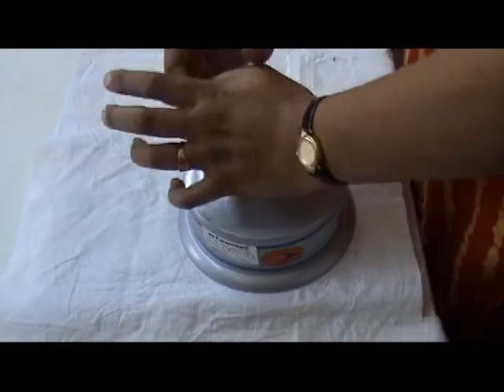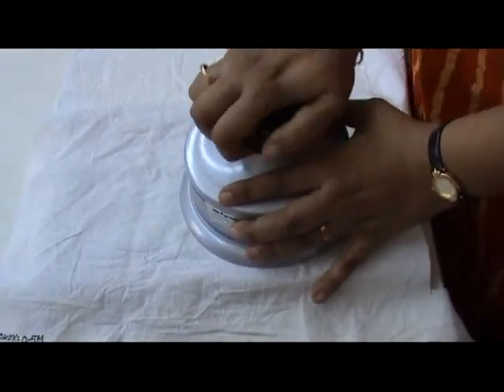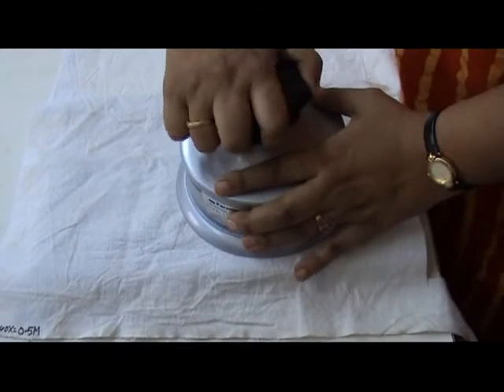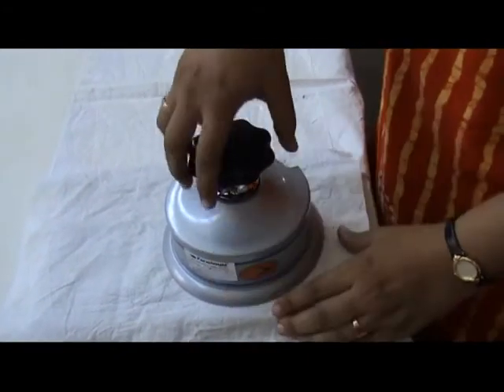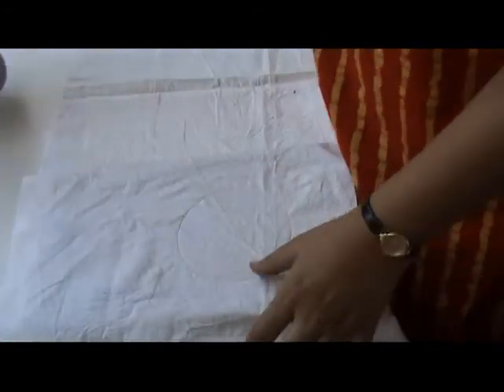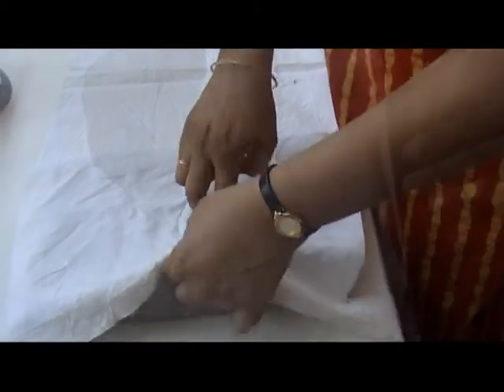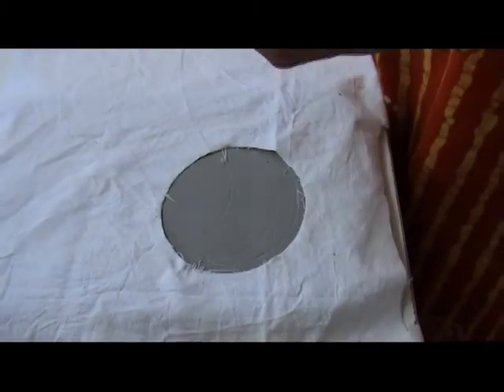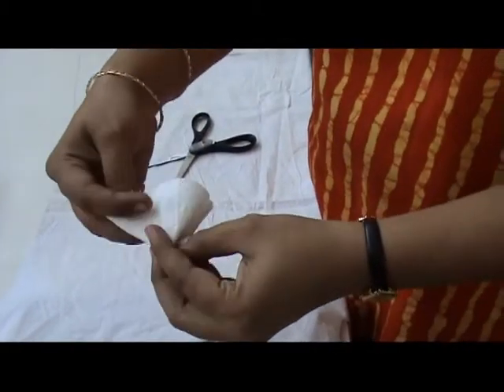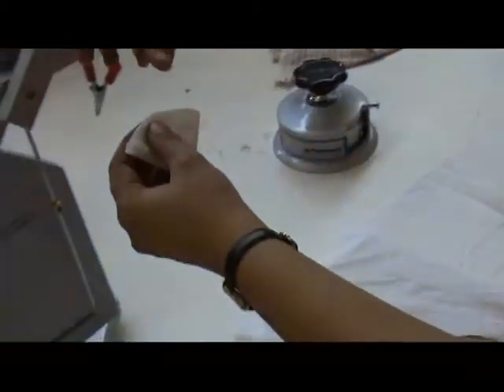The round cutter is kept on the surface of the fabric and the weight of the round sample is measured with the help of the balance. On multiplying the weight by 100, we get the GSM of the fabric.